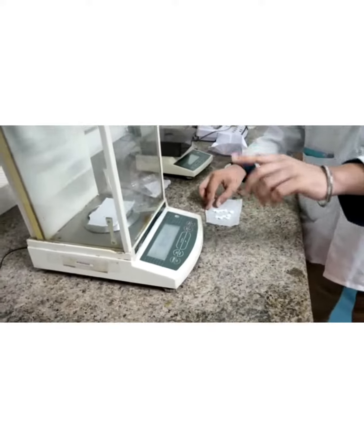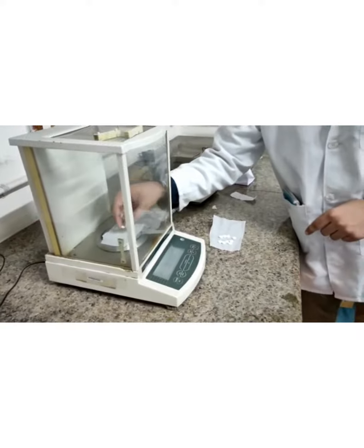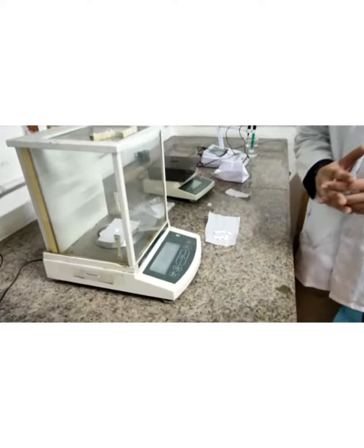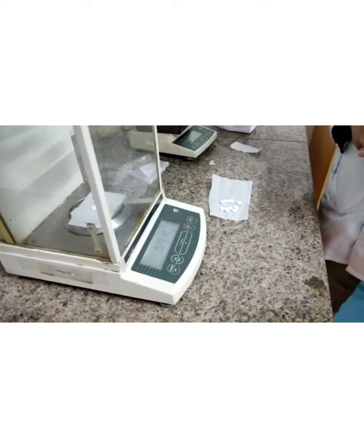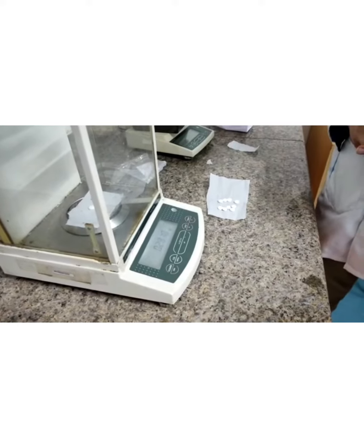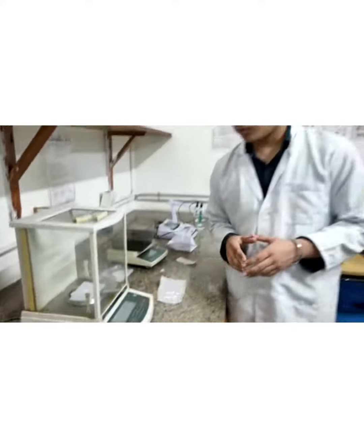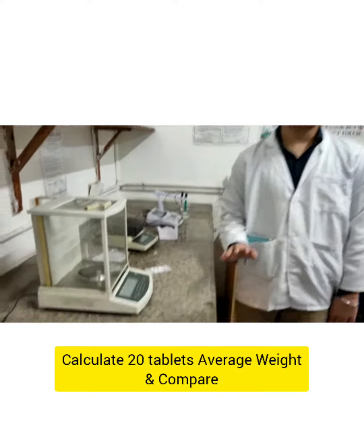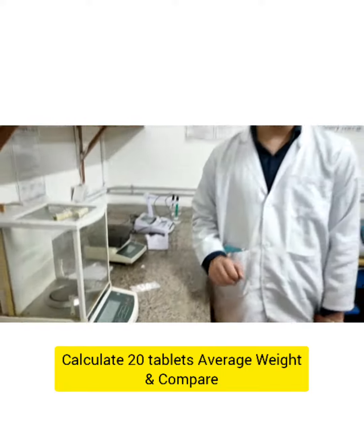We have tared it to zero. Now we are going to put each tablet. As you can see, the weight is coming out to be 251.9 mg for the first tablet. We have completed the weighing of all 20 tablets and calculated their average weight. From this we can calculate the weight variation.